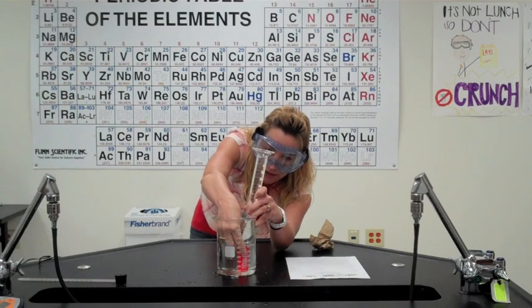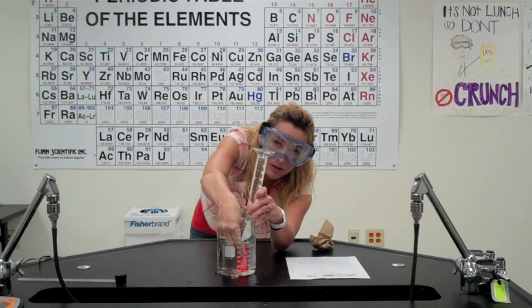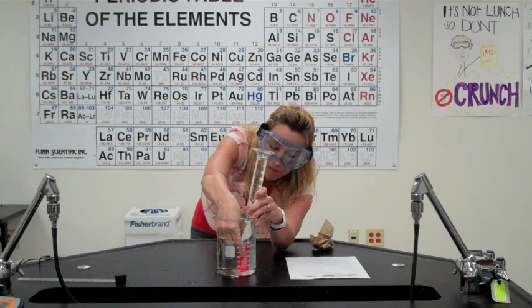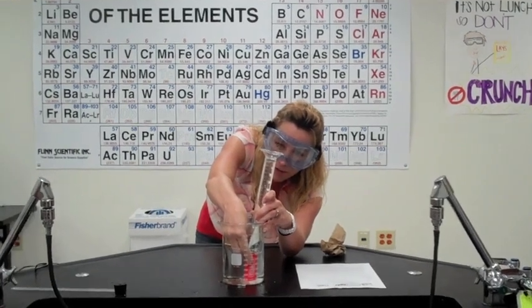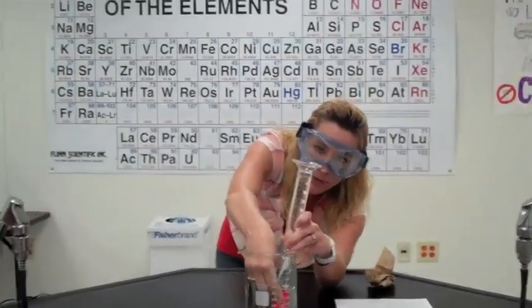I'm going to collect my 90 milliliters of gas. All I'm doing is pressing the plastic lever down at the bottom and the butane is just bubbling up through the water.